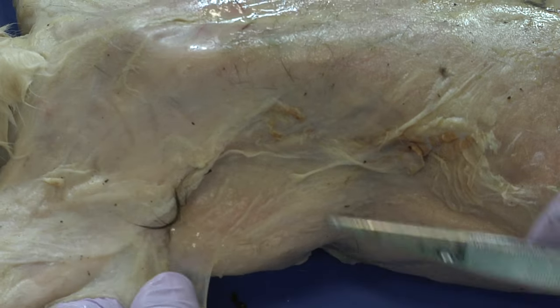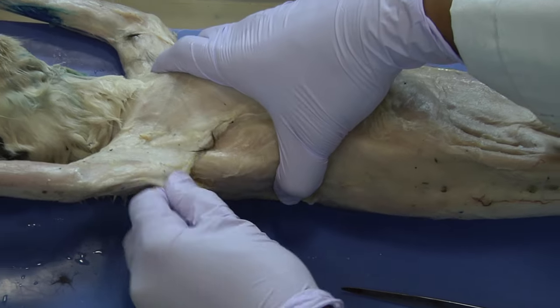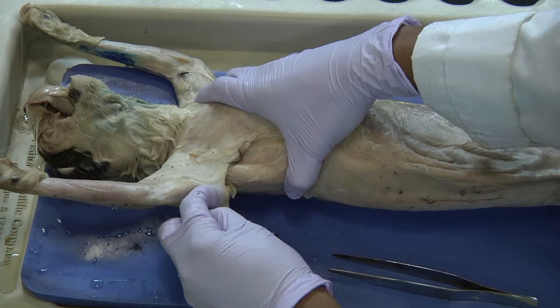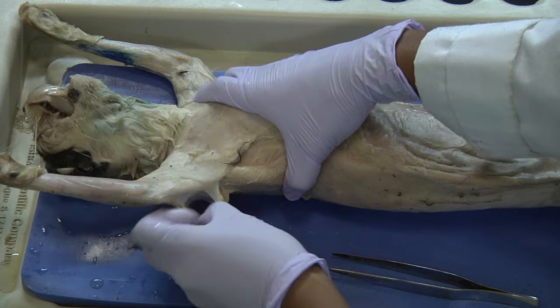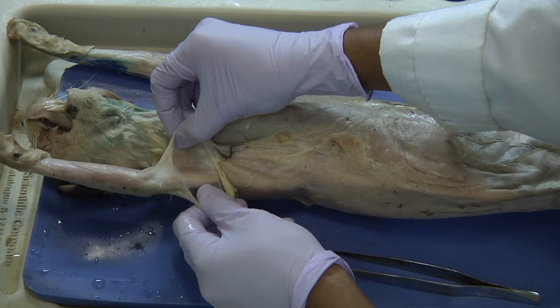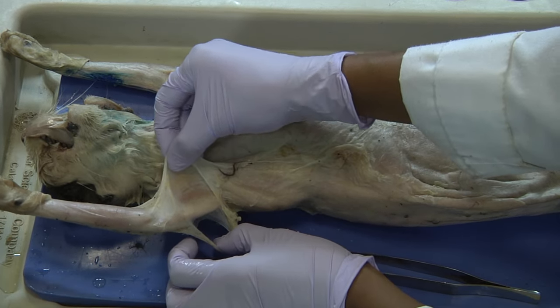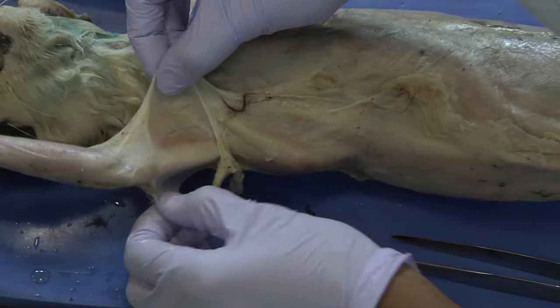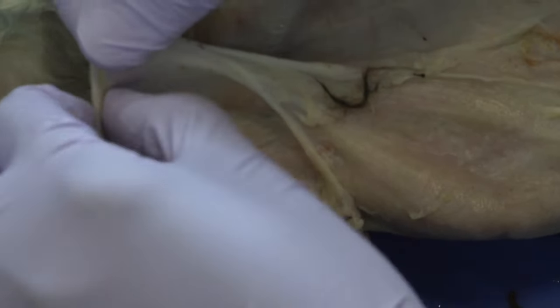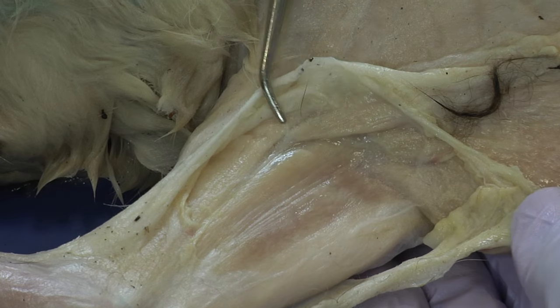You can also use your fingers to help safeguard against removing too much muscle, since they're less likely to grip deeply. There is very little strength needed to remove the loose connective tissue. Here I've just revealed some areolar tissue — if you zoom in, you can see it is somewhat spider-webby. As soon as you can see the striping of that muscular tissue, that's how you know you've gone as far as you need to go.